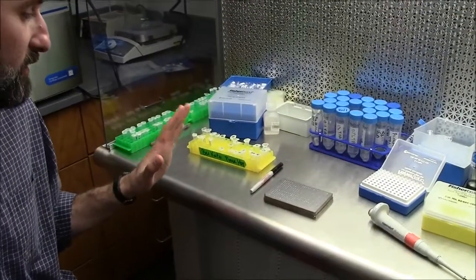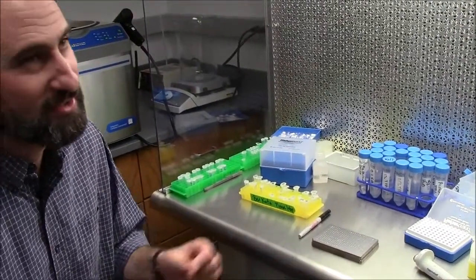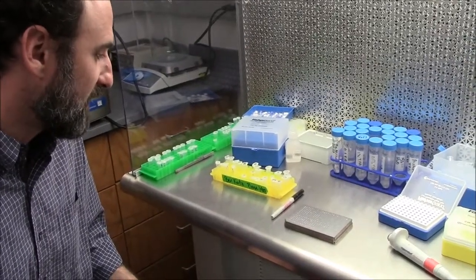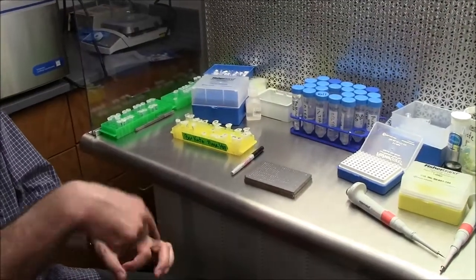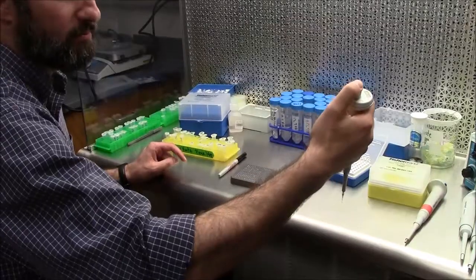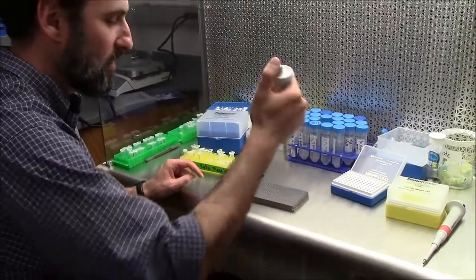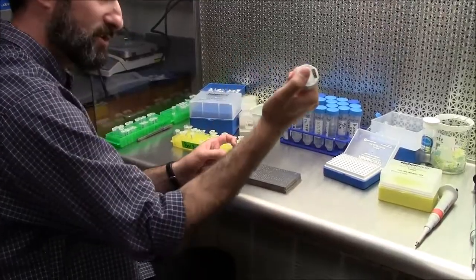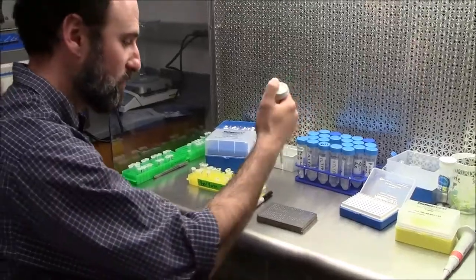Always forget where I spot it. It's a 384 plate. You're never going to find it inside the instrument. It's just a tiny zoomed in camera, so write down where you put it. These types of targets actually have a coating around the edge of the circle so you can load larger volumes without them spilling over the edges. Put it inside the solution, otherwise pressure won't give you a droplet. You don't want to kick the droplet out all the way. You want to make sure that when you eject the droplet, you basically just do the light one, and the droplet will actually hang off the end of the pipette tip, and you want to touch it off.